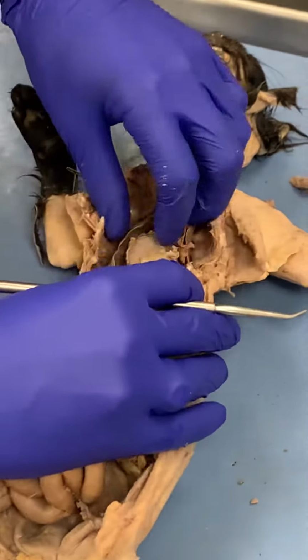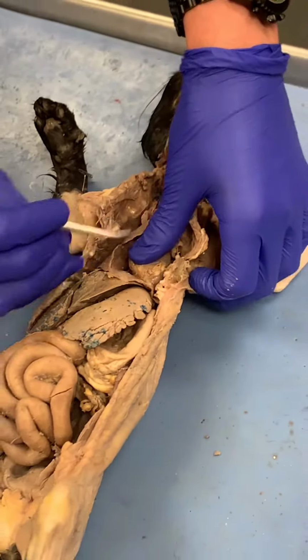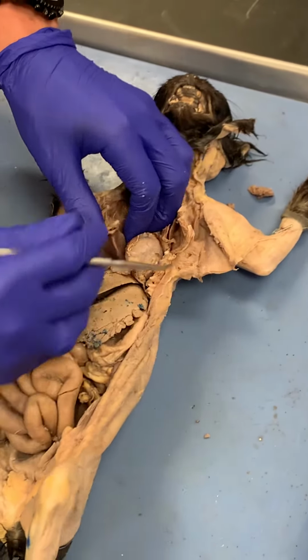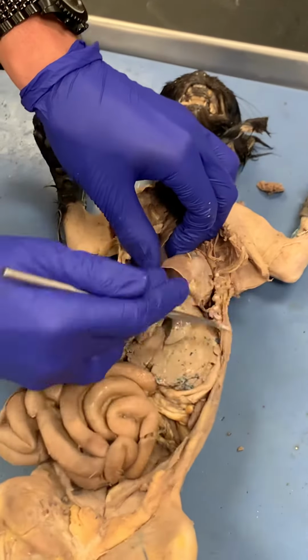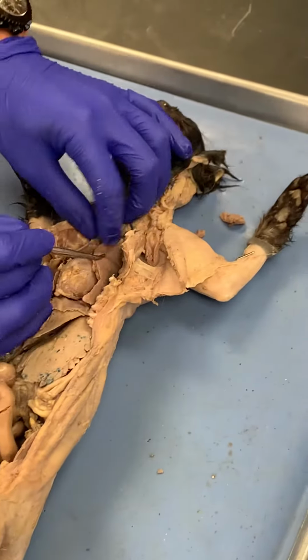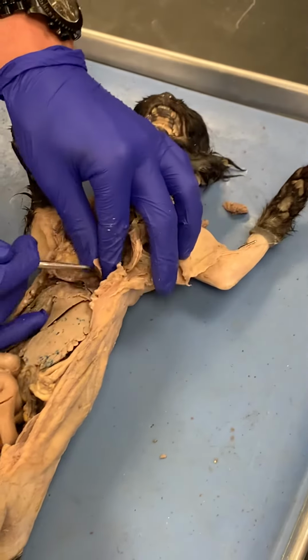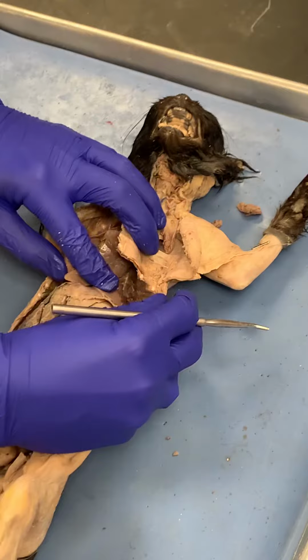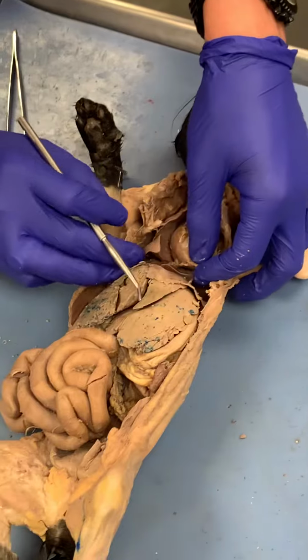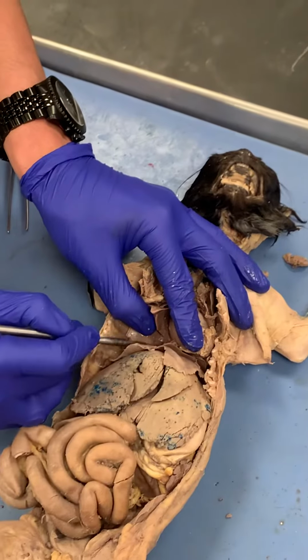The three different lobes on the lung for the cat: you have the anterior here, and then the posterior is here, the bottom, and then this one is the middle. So this right here is the middle. And it's the same thing on this side. So anterior, and then middle, and then posterior right here on the back side. And then you also have the mediastinal one, which is kind of deep, but that's what's back there, the mediastinum.